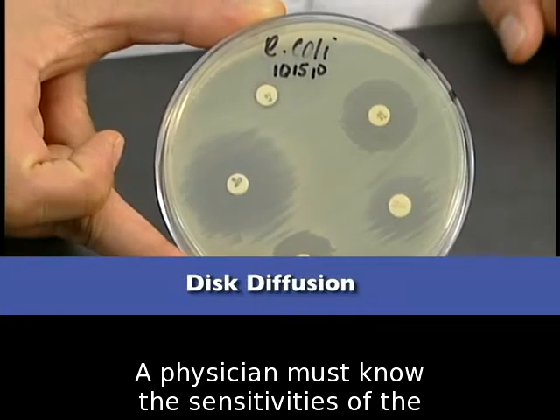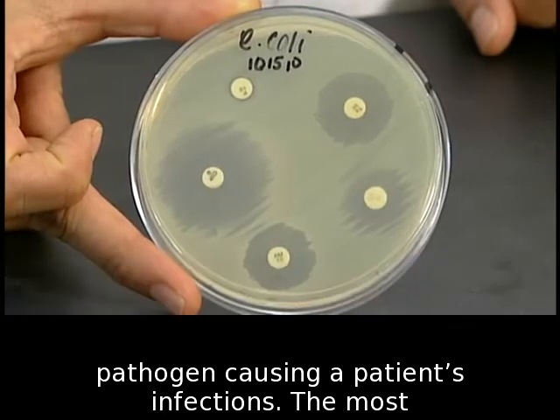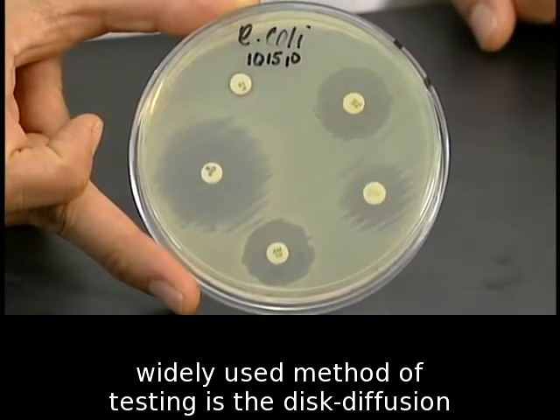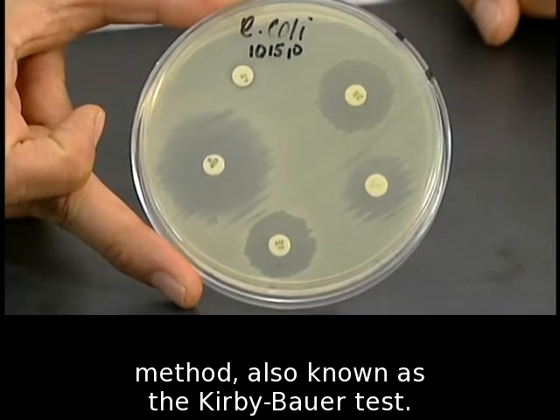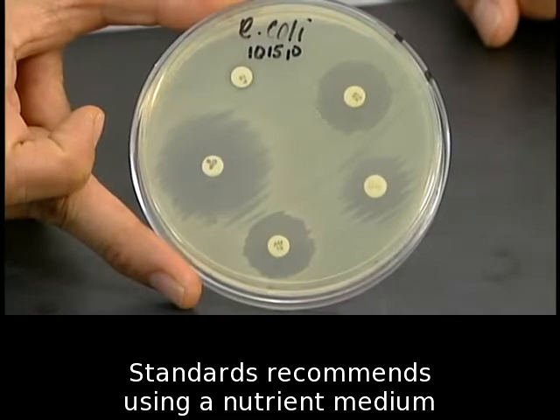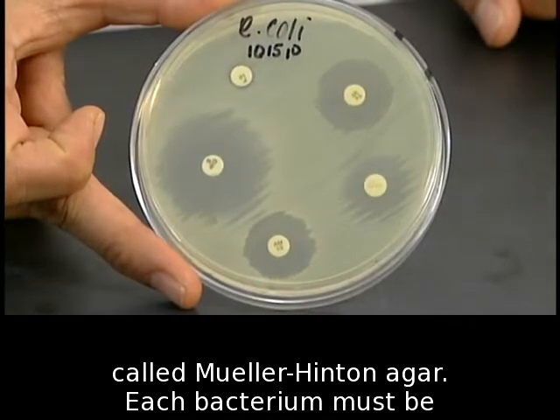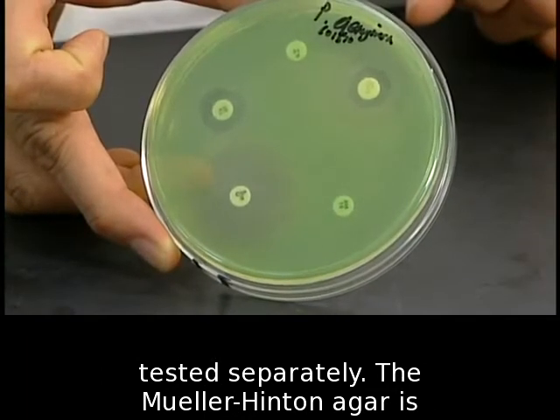A physician must know the sensitivities of the pathogen causing a patient's infections. The most widely used method of testing is the disc diffusion method, also known as the Kirby-Bauer test. The National Committee for Clinical Laboratory Standards recommends using a nutrient medium called Mueller-Hinton agar. Each bacteria must be tested separately.